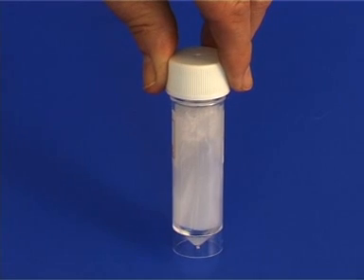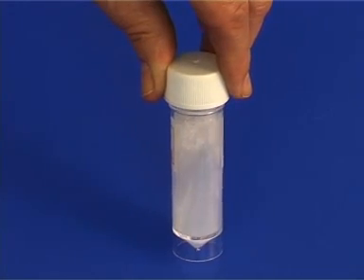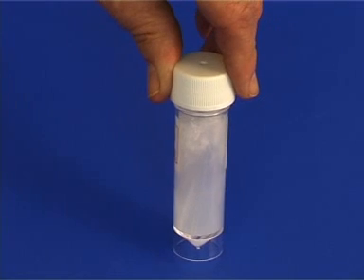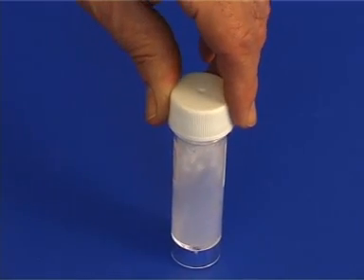Make sure your hands are free of any traces of sodium acetate. If you handled the crystals before starting, make sure to wash your hands before performing the experiment.